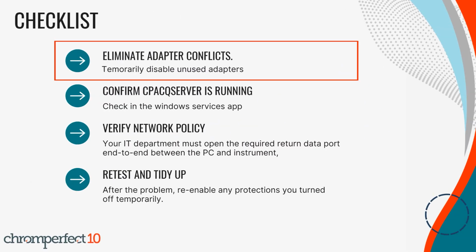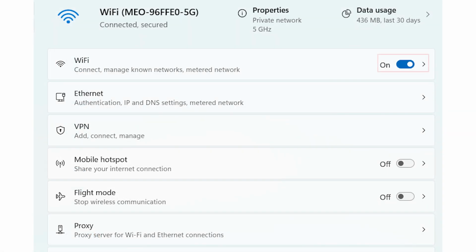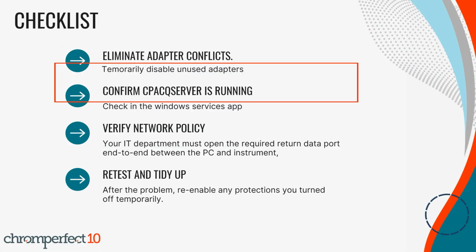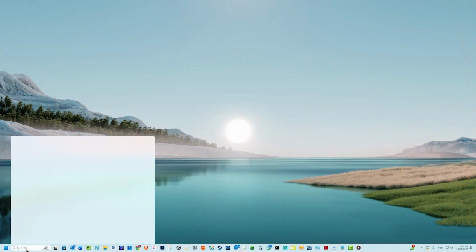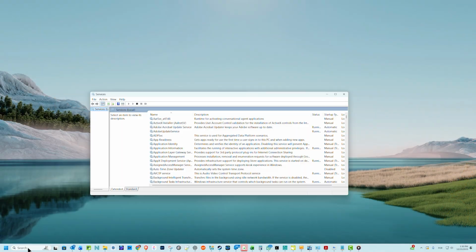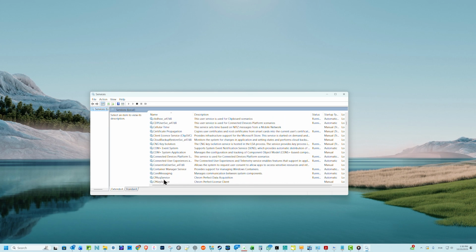Step 5: Eliminate adapter conflicts. Systems with both Ethernet and Wi-Fi can misroute return data. If you are cabled, temporarily turn off Wi-Fi and any unused adapters in Settings, Network, and Internet, then retest. If you are on Wi-Fi, disconnect any Ethernet docking station, then retest. Step 6: Confirm the Chromperfect Acquisition Service is running. Open Services. Look for the Chromperfect Acquisition Service. If it is stopped, start it. If it is running, restart it.